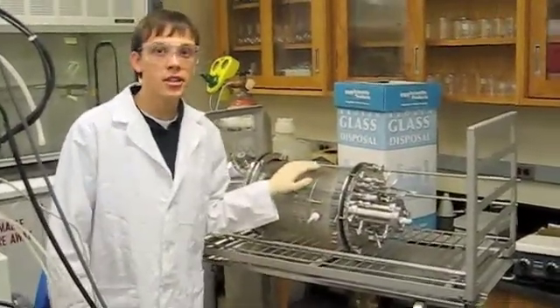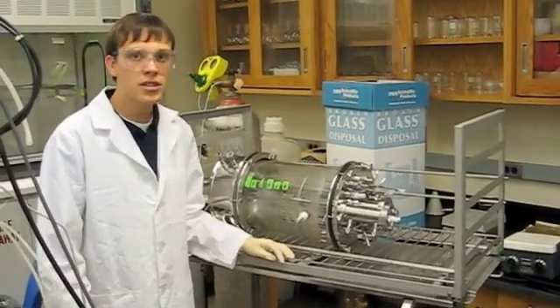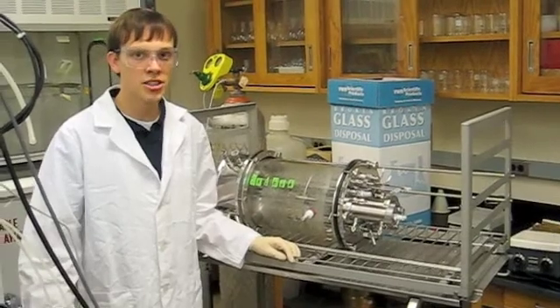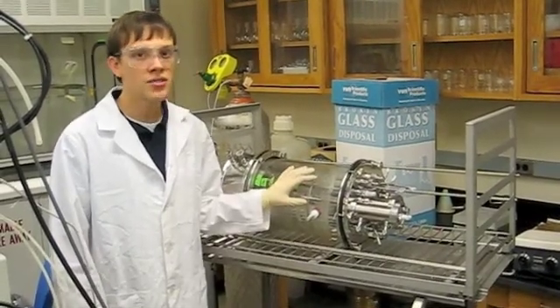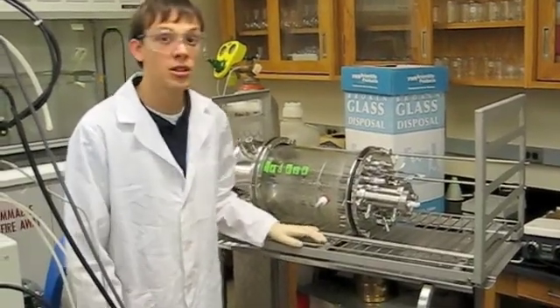All right, so here's our 10-liter vessel that we're using. The reason that we're using a 10-liter vessel is because we're trying to scale up our production. You can also find these vessels in 4 and 6 liters and other sizes, but we chose to use a larger one.